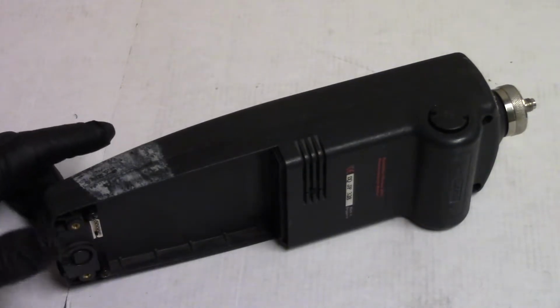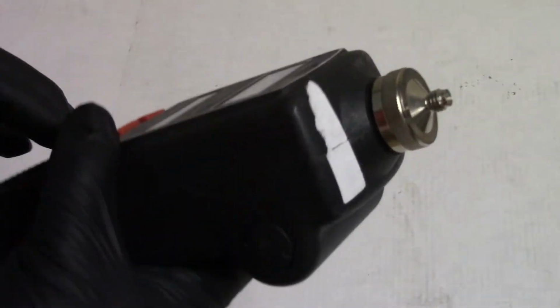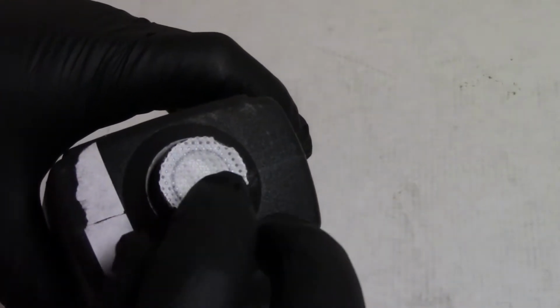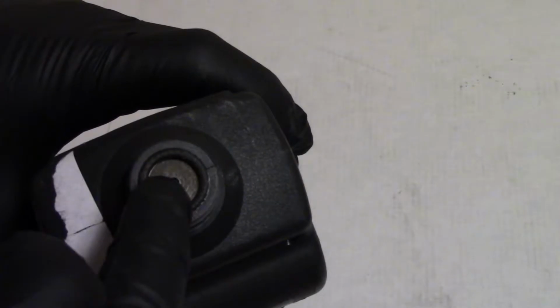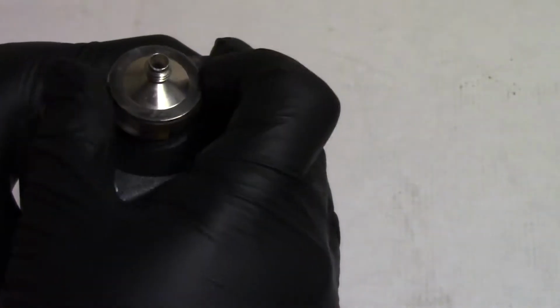We'll see. The way it works, a quick overview, is there's a little air pump inside that sucks air in through the front. Behind this cap, there's a particulate filter right here. And that particulate filter, you can see it goes over top of that washer. Then the sample's pulled in through that hole. I'm leaving the filter on just because I'm keeping it all together, and I don't want to draw any crud into it just in case.